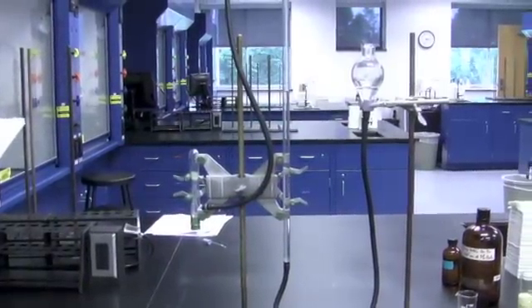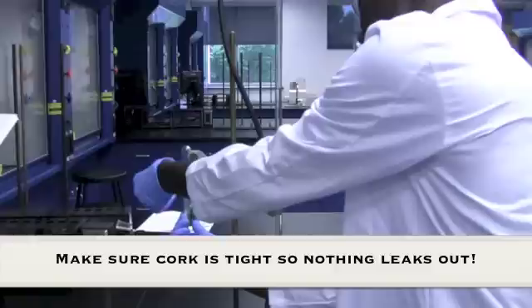The sidearm test tube should now be inverted and gently shaken until the reaction is complete.